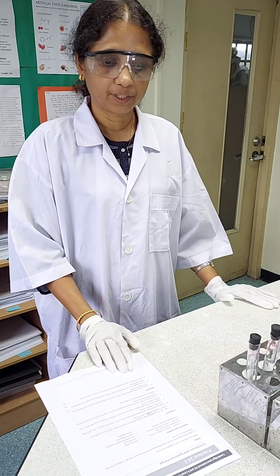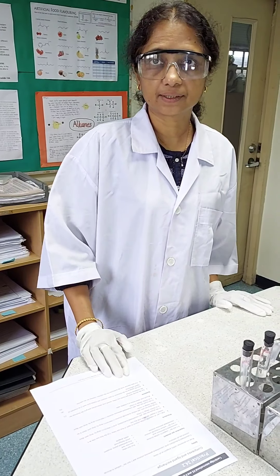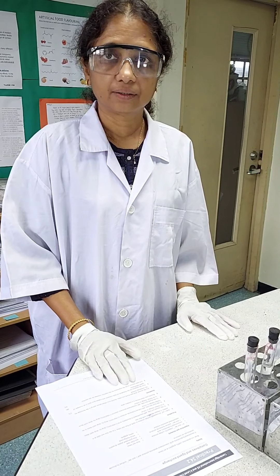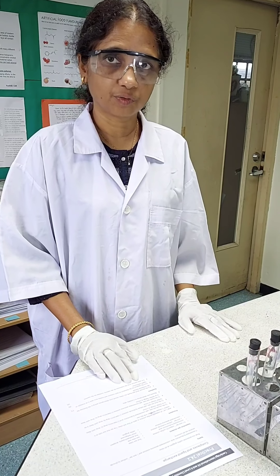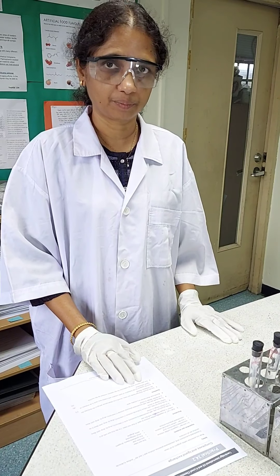Hi there, today we are going to do an experiment regarding complexes and ligand exchange. This is an experiment of the transition metal complexes formed in a reaction. We've got to identify and name the complex formed.